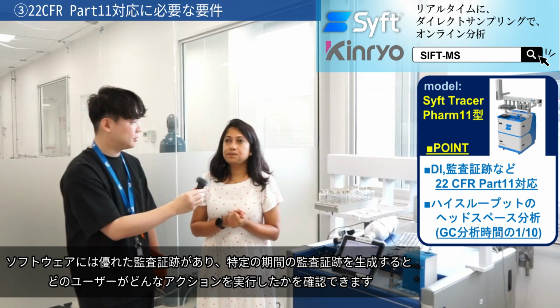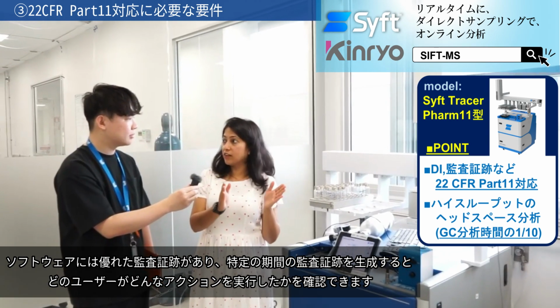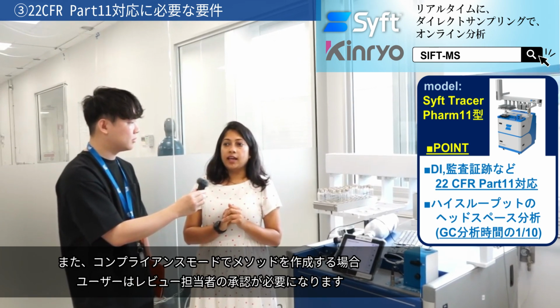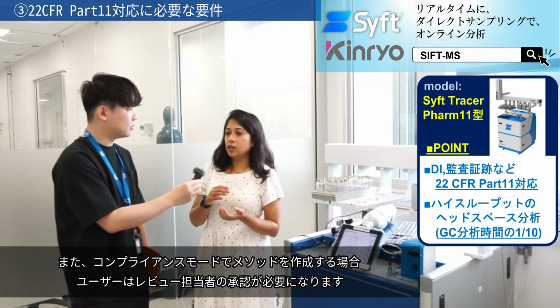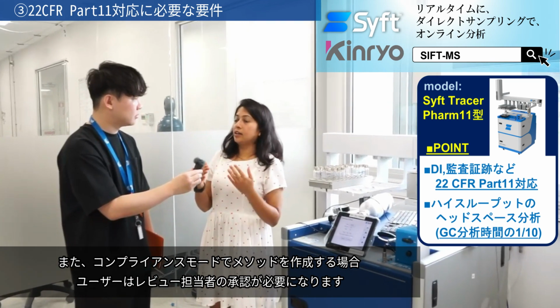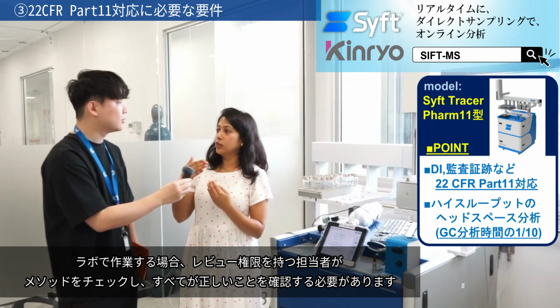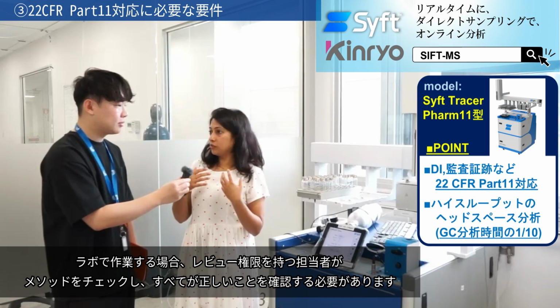There is a good audit trail. So if you generate an audit trail from us for a specified period of time, you can see which user did a certain action. When a user creates a method in compliance mode, they also have to get it approved by a reviewer, someone who has reviewer rights. So if you're working in a lab, there has to be someone else with proper reviewer rights who would check everything, the integrity of the method, and make sure everything is correct.